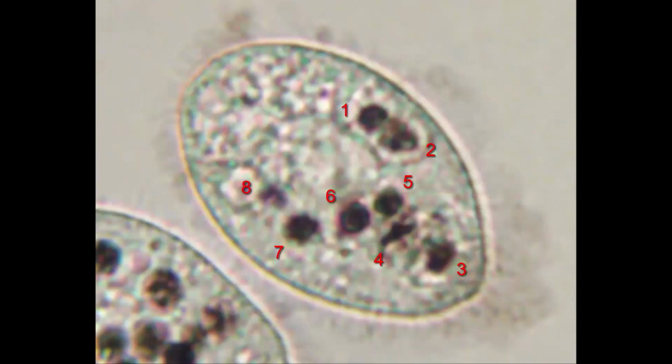The most important thing is to be consistent. If you use different standards for what counts as a vacuole for your control and your experiment, you're introducing a bias that can skew your results. And unless you're actively thinking about this and avoiding it, you could be doing it subconsciously.